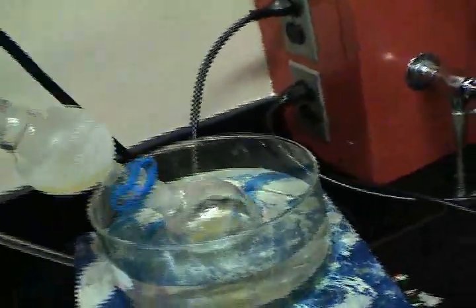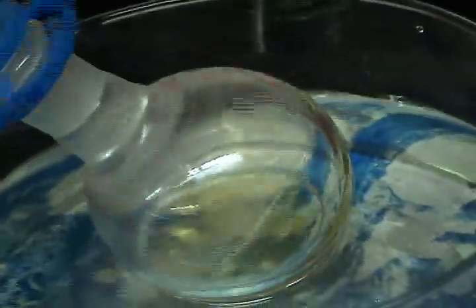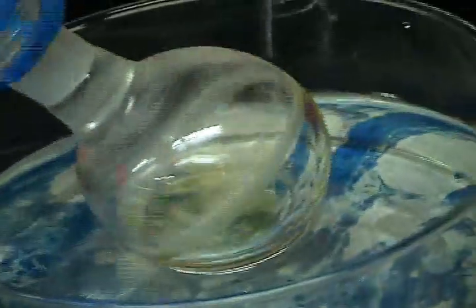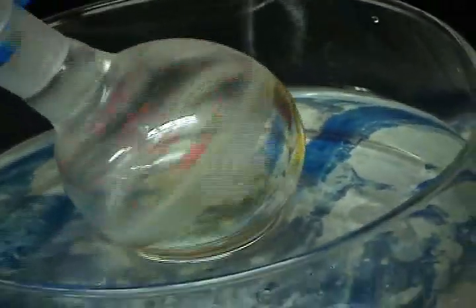We're just about finished with the rotovapping. You can see the amount of solvent in the flask has decreased. As it vaporizes, it will start to leave a film of solid.